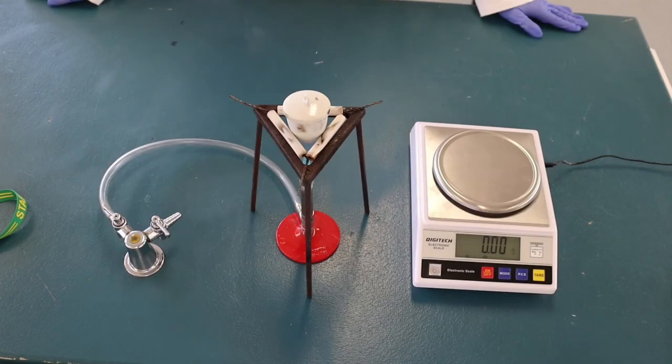Remove the lid and heat the crucible for a further 5 minutes to ensure the complete reaction.